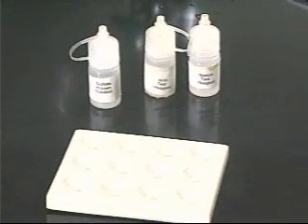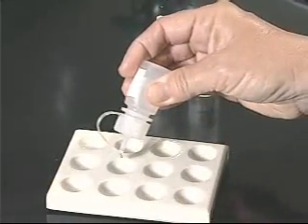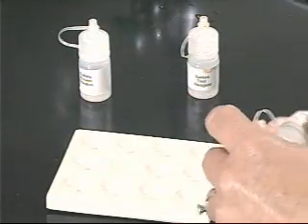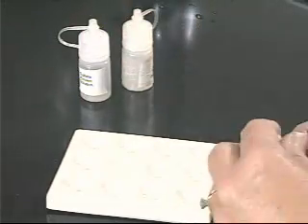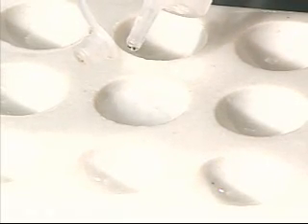To show the formation of a precipitate, I'll first add the known anion and the reagents necessary for this test. I'm first going to make it acidic with a couple of drops, and then add the test reagents. In this reaction, you can see a white cloudiness has occurred — this is the formation of a white precipitate. If you allow it to settle for a little while, you will be able to see the white solid in the bottom of the well.